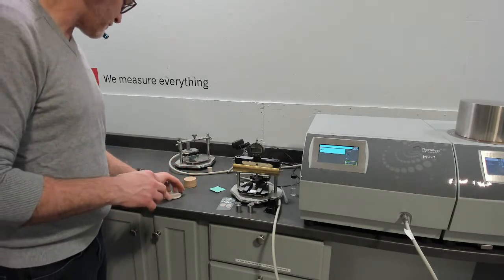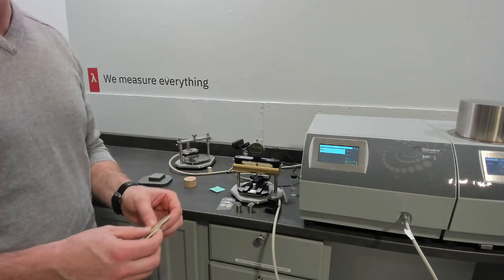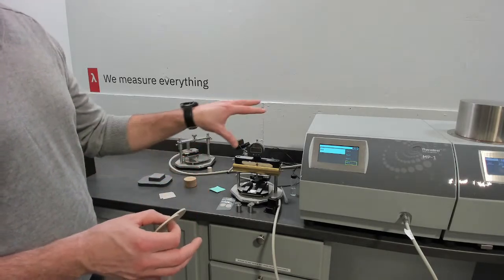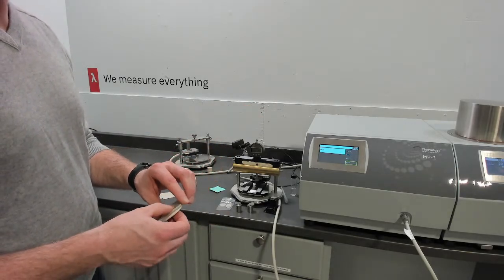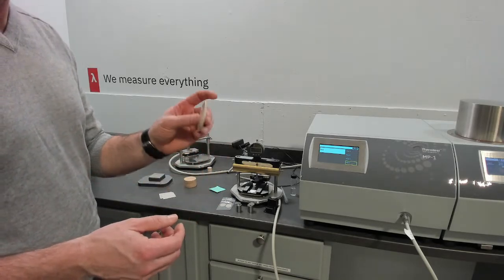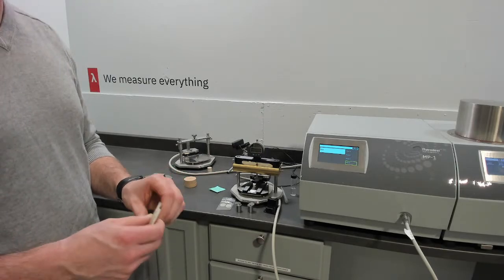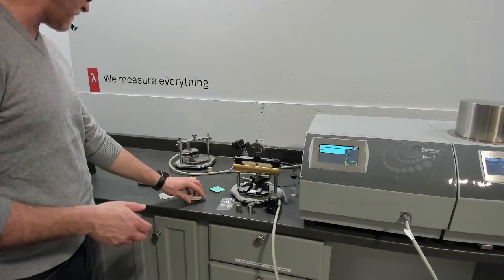I guess the only other approach to PEEK would be if you want to measure through the melt. So we have a very specific cell for measuring polymers through the melt, and it is very clean. It's still using the transient plane source method. It doesn't destroy the sensor, and we've made those measurements of PEEK, of course, up to 400 degrees. You can find information on the melt cell option on our TPS. Of course, we will eventually have a demonstration on the melt cell as well. So we've been doing polymers through the melt for quite a long time.